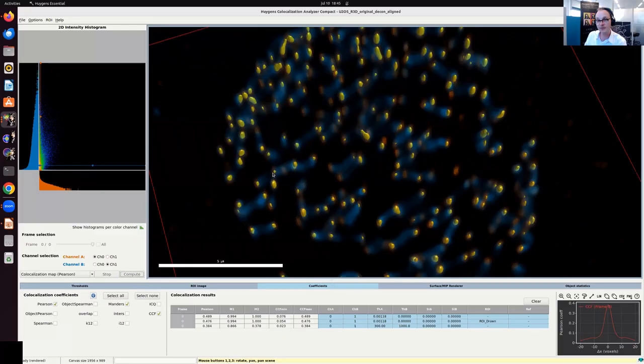And we can understand that very well because the orange is always included in the blue, or most of it, 85% is. But there's a lot of blue space which isn't covered by orange, so that's only 38%. So then the Manders coefficient actually gives me the information that I, of course, can also visually see, but I can also quantify it in this way. And by doing it this way, I can disentangle this information.